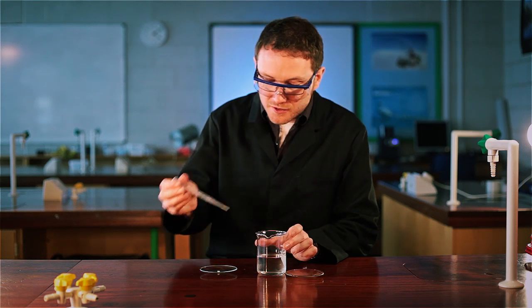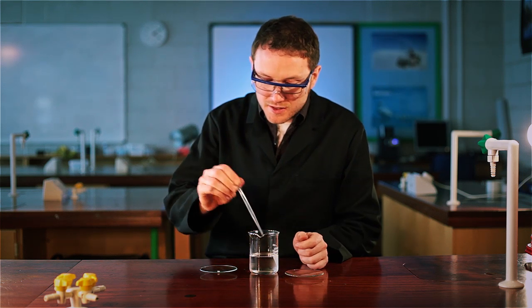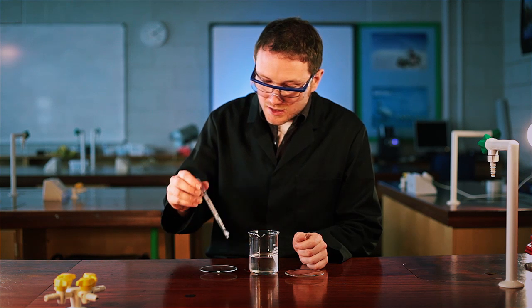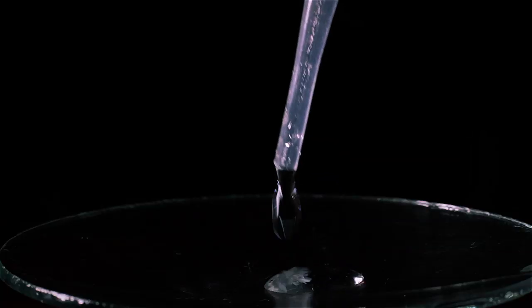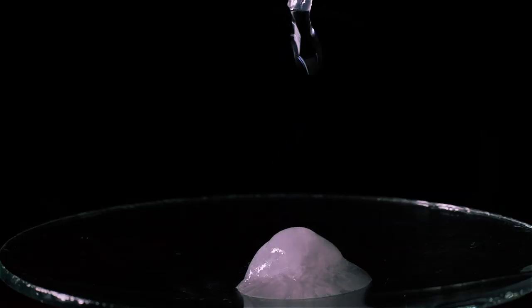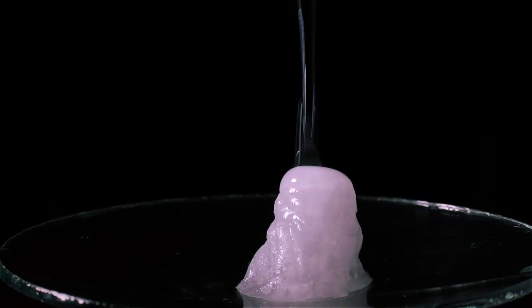Start off with a crystal of your sodium ethanoate down on the watch glass, and you can begin to build some stalagmites.